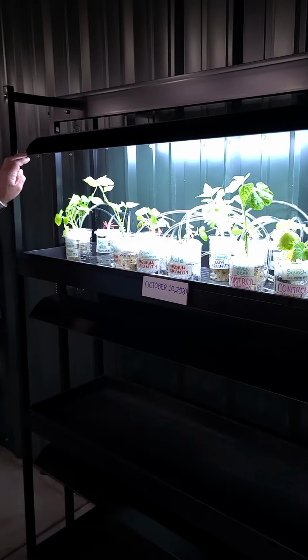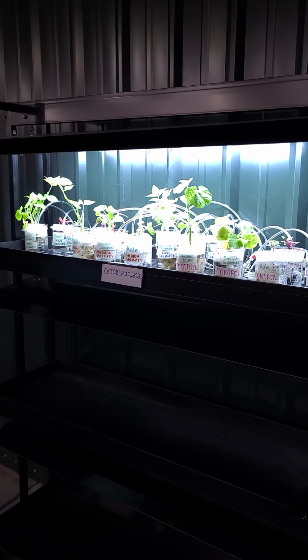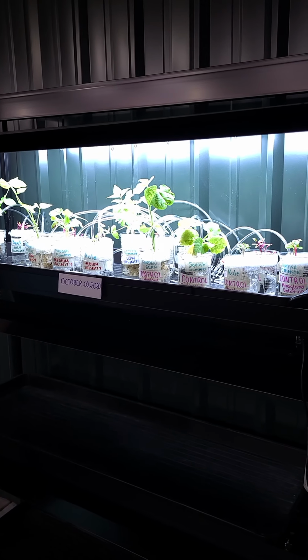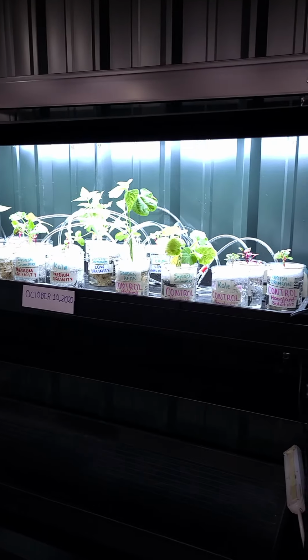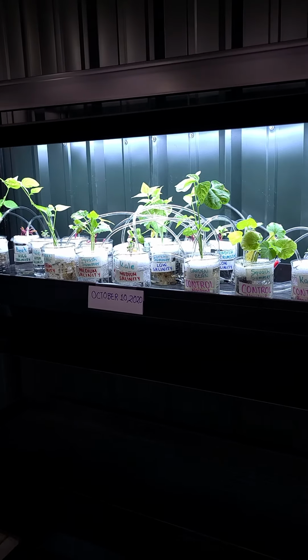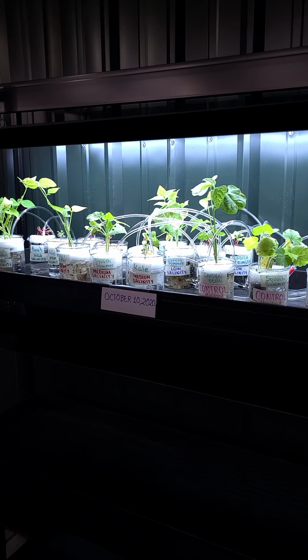I'm not sure if I'll run this for a week or maybe 2 weeks, but at least a week, and we'll come back and see what these look like. So they're all beautifully labeled. So when we have some things to actually compare, we'll focus in on the individual plant species or different varieties, I guess, of vegetables that we've got here, and see how they're actually behaving. So that'll be in an upcoming video. So that's it for now.